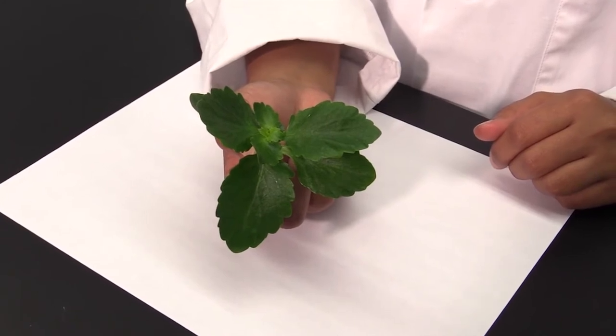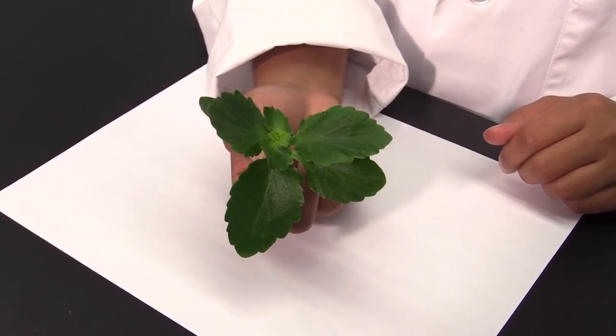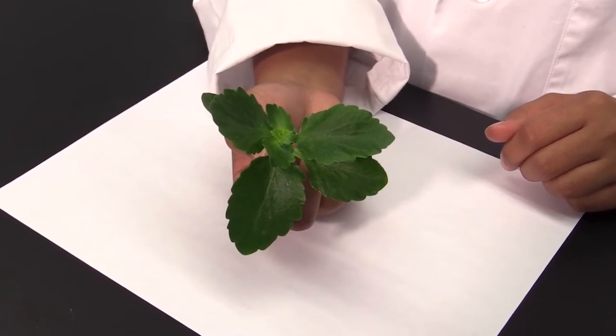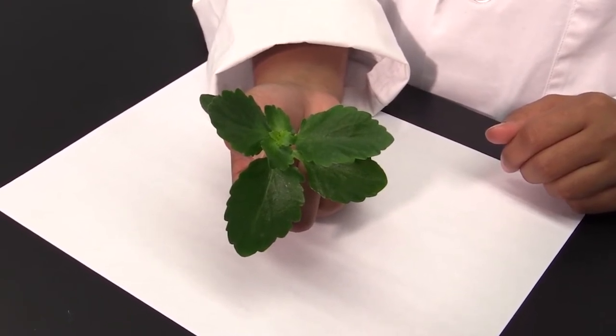After 10 minutes of recording, get yourself a new plant. Once you have the new plant, you can start the surface peels described in Part C.